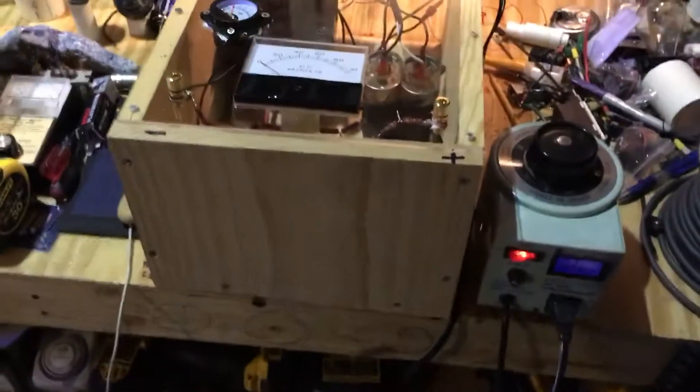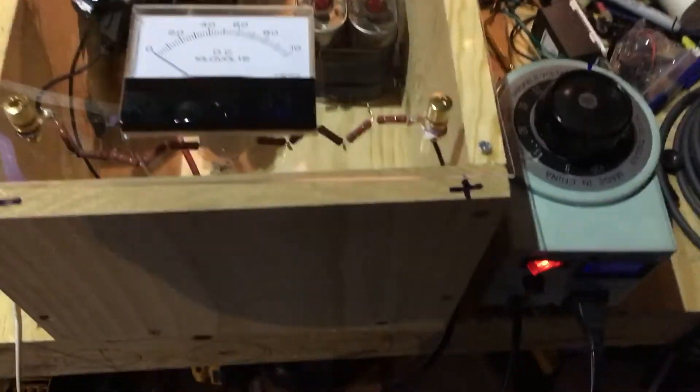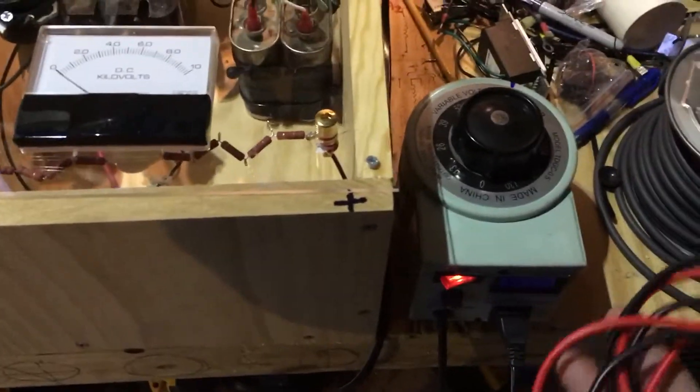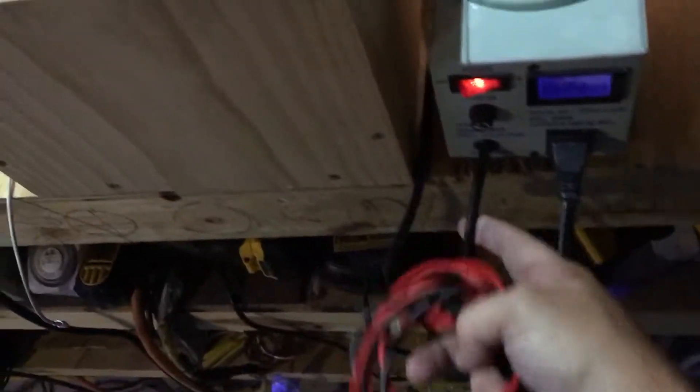All right, this is a how-to video for how to use this thing. This is the seed treatment apparatus that I've assembled. It's got the Variac. Variac gets plugged into the wall. That's this cord.